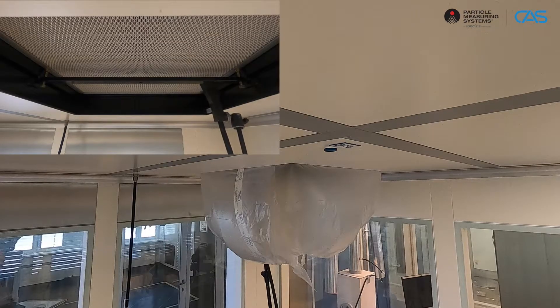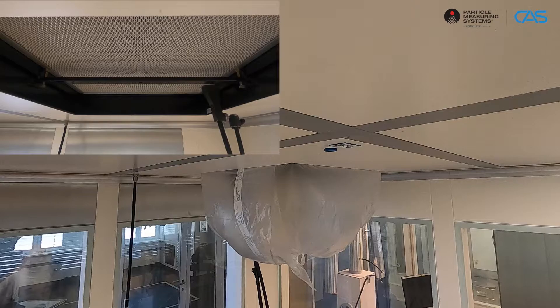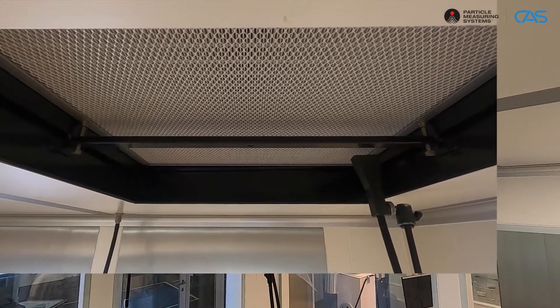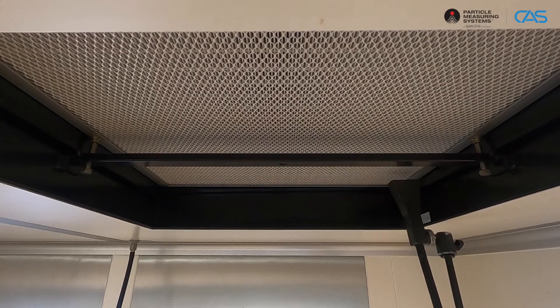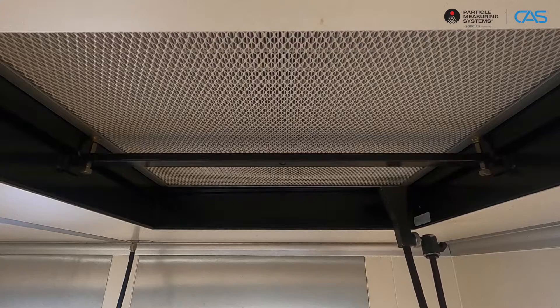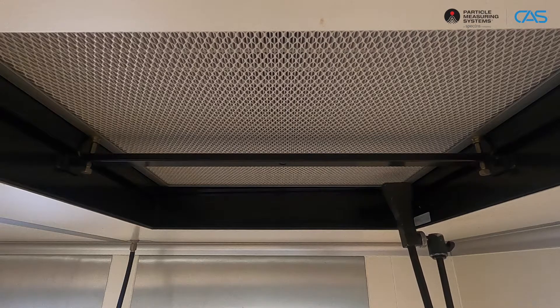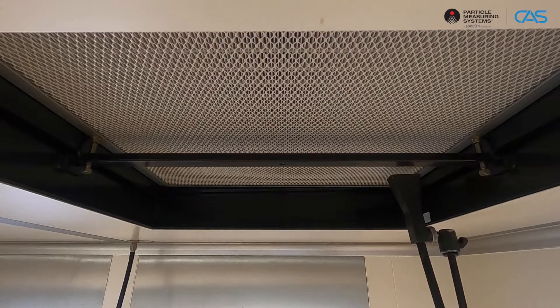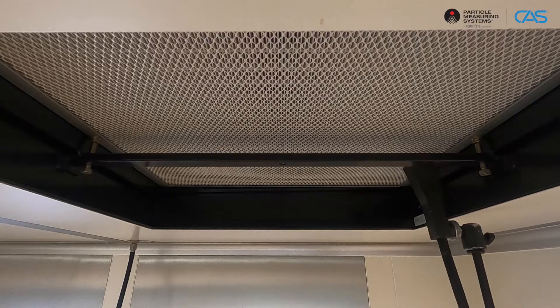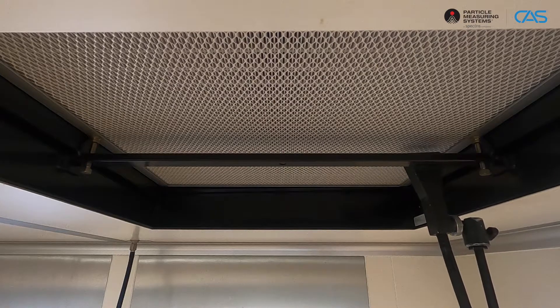Let's start with the scanning process, which is divided into stage 1 and stage 2. In the stage 1 scanning process, a measurement probe is used to scan the filter at a speed of 5 cm per second in slightly overlapping tracks.